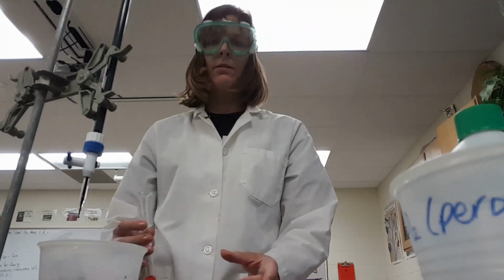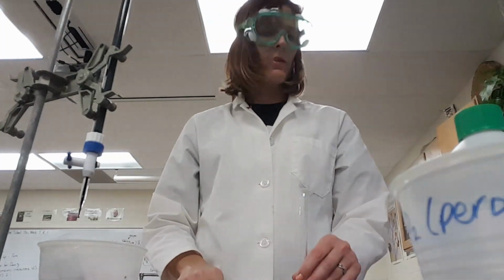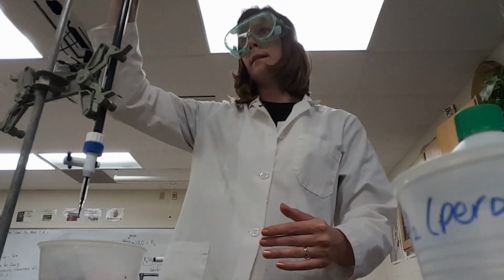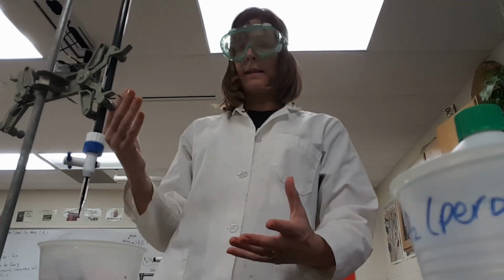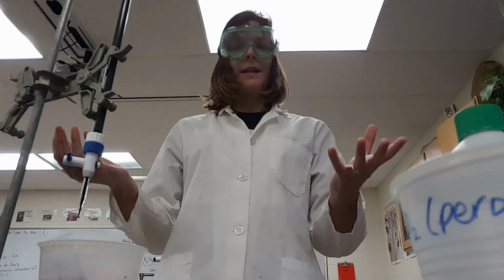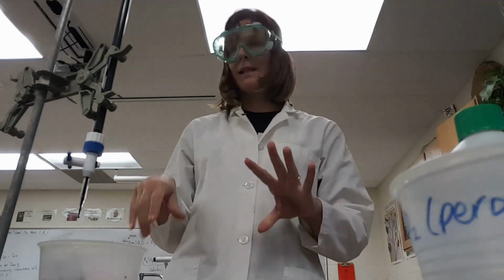Okay, now what do you think? Do you think that this reaction is going to go more quickly this time? Do you think I'm going to reach my end point by letting more in or by letting less in? Is it going to go faster or is it going to go slower this time? What do you think? Think about it and we'll see what ends up happening.